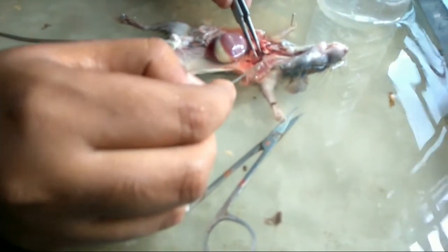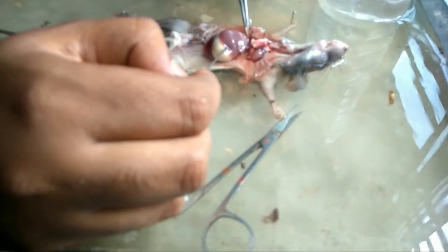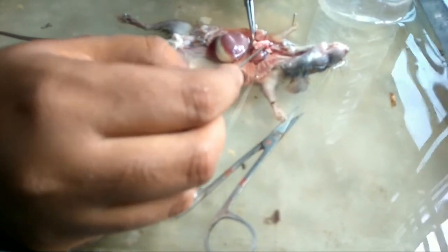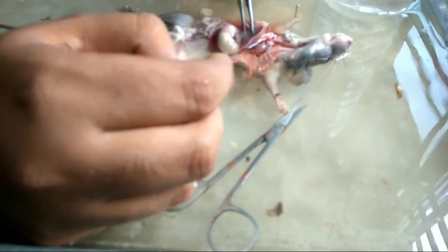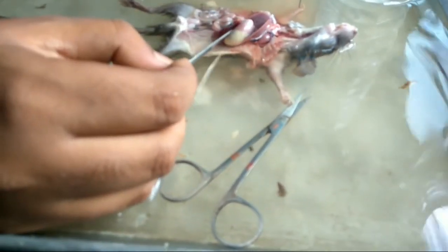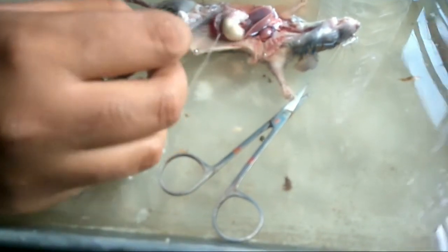This is the remnant of the diaphragm, just between the liver and the heart. Below the diaphragm you can find the liver, then the stomach, small and large intestine, urinary bladder, gonads, kidney, and so on. The spleen also lies in this region.